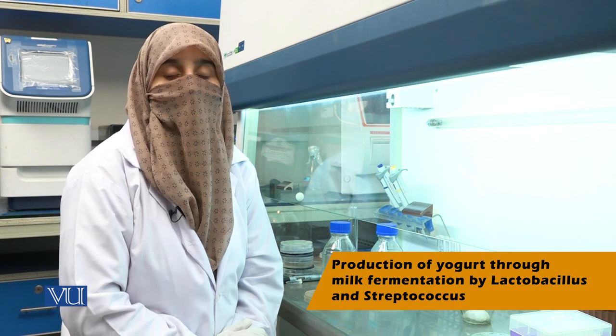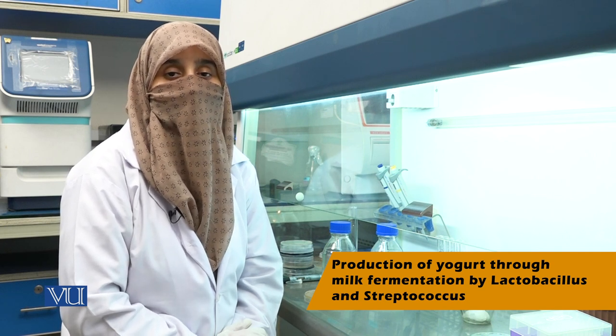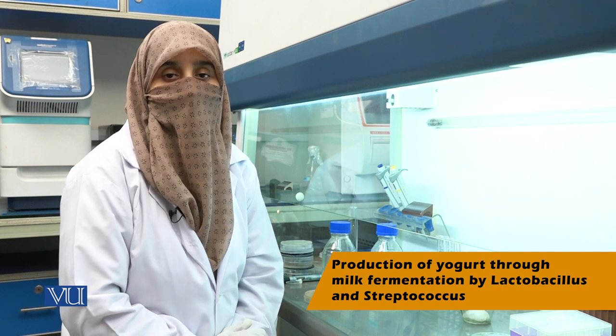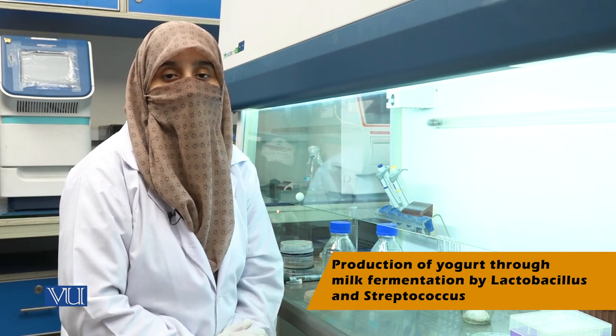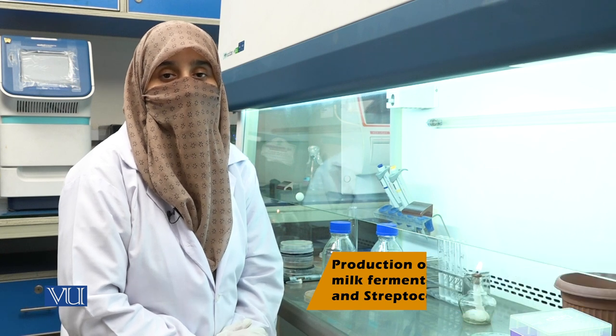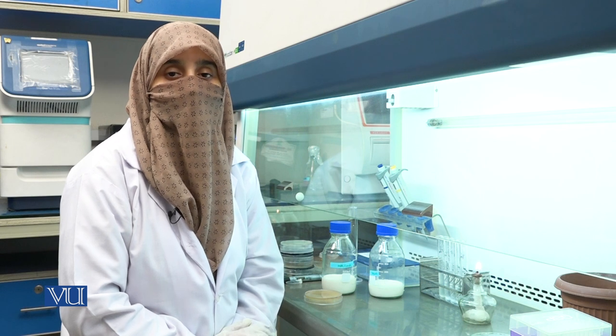Lactobacillus are commonly used in food industries. These bacteria have the ability to ferment lactose into lactic acid, which is the basic product after inoculation into the milk. For the preparation of the fermented product yogurt, the following procedure is used.